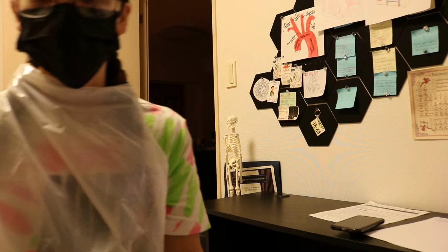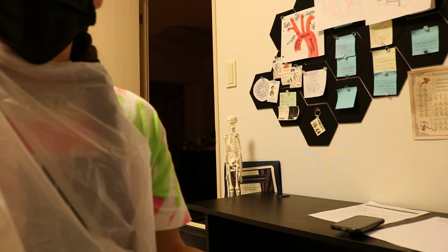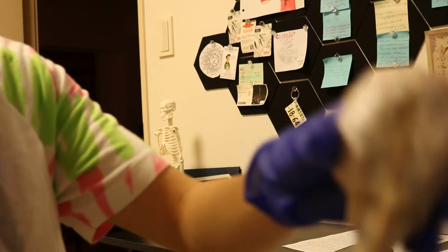Hi, my name is Nicole and I'm going to be going over the structures of the brain with the sheep brain here. And I have my structures list posted right over there that I'll be using to refer to. Alright, so we're going to go ahead and get started with the exterior portion of the brain.